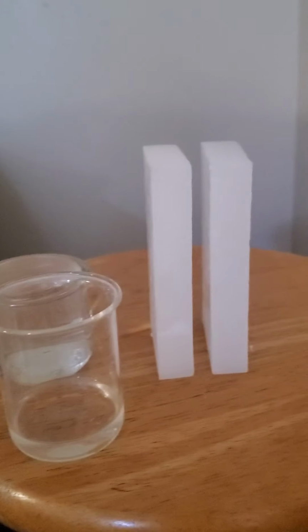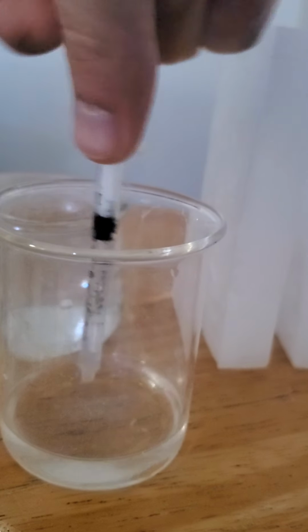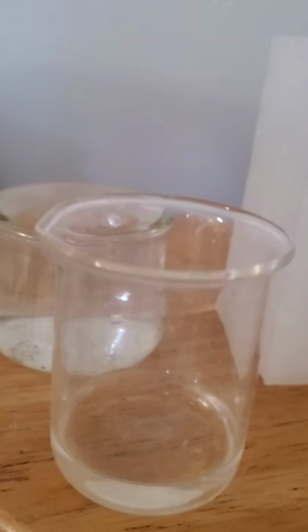What's going on here? One more thing that you're going to want, you see that I got two little wax blocks. You're going to want something to hold up your syringe, because I don't have enough hands to do all this. So you can just hang your syringe from there. And we're going to use surface tension. Going to suck up my pond water. Pond water is a really good option for this too, although this is aquarium technically.